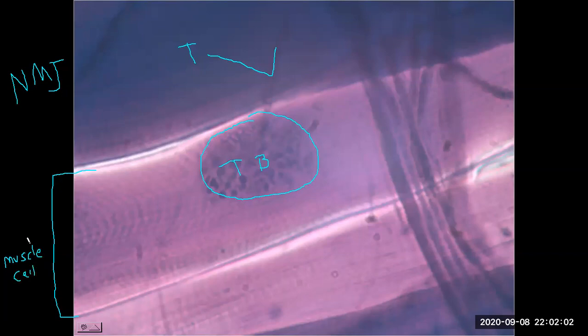And on the skeletal muscle fiber, now we can see the alternating dark and light bands, or A and I bands. Looking at the striping, the banding, we have the term striations, and there's both the dark and the light striations. And for this sample, we're just simply using the term striations. You can refer back to the skeletal muscle histology specifically for the A and I band terminology.